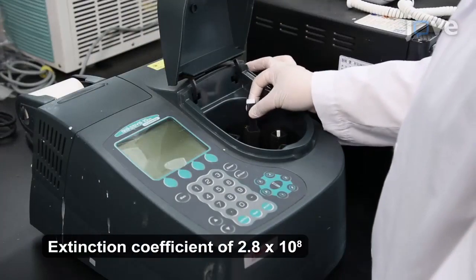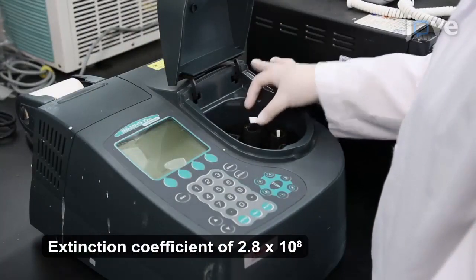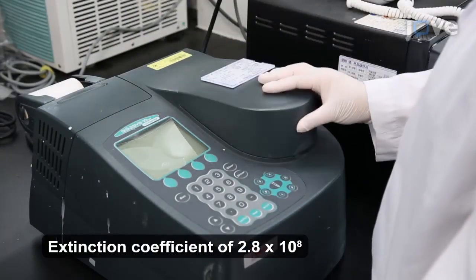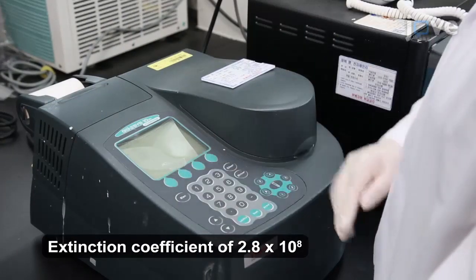Measure the concentration of the gold nanoparticles with UV-Vis spectroscopy at a wavelength of 520 nanometers using a quartz cuvette.